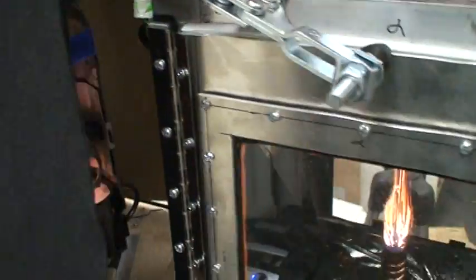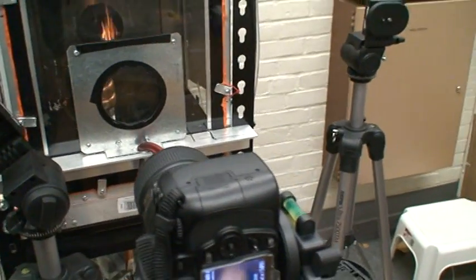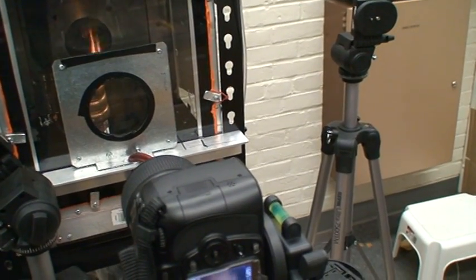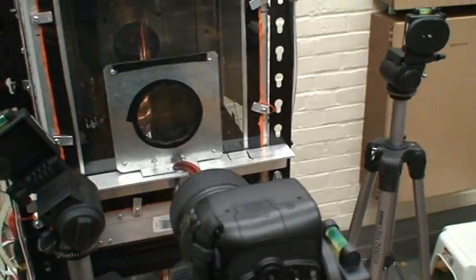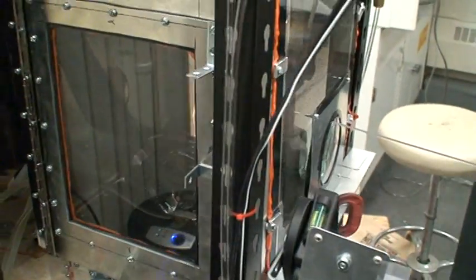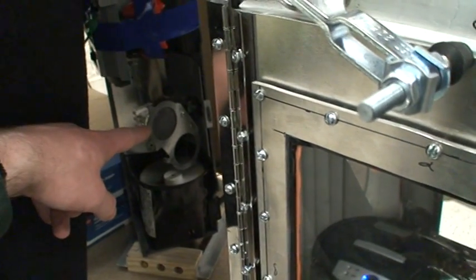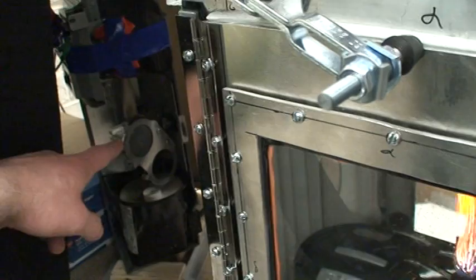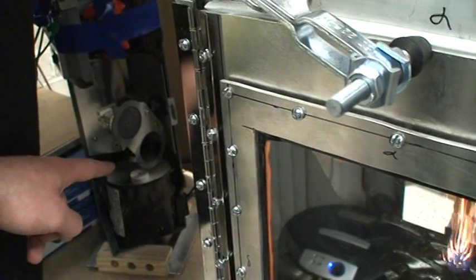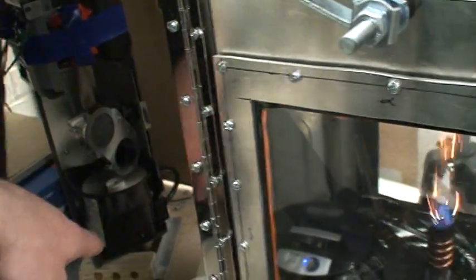This light tends to overheat. You can use a bright LED. We've ordered one, but it hasn't come in yet. I'm trying to think if I wanted to mention anything else about the Shadowgraph at this current time. So it's fairly simple. Point source of light. The larger this pinhole is in your light source, the more fuzzy your image is on the backside. So to get that as small as possible is good. This light overheats quickly, so it's important to have a cooling fan running. And you have to use a rather thick steel plate, otherwise if you use aluminum, it'll melt through.